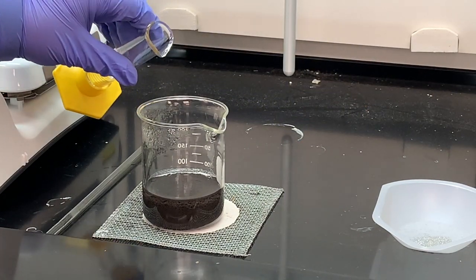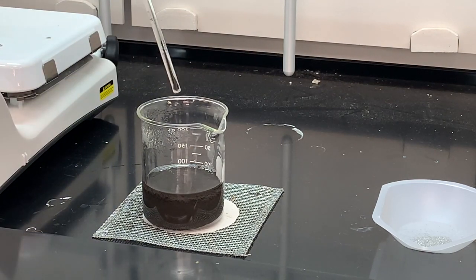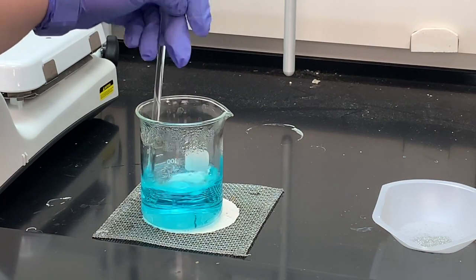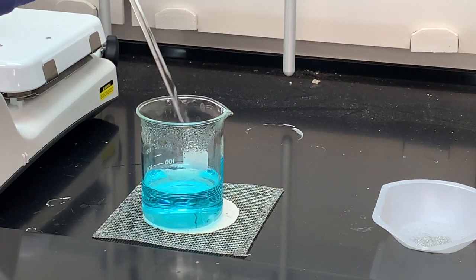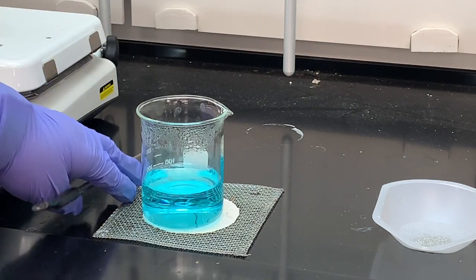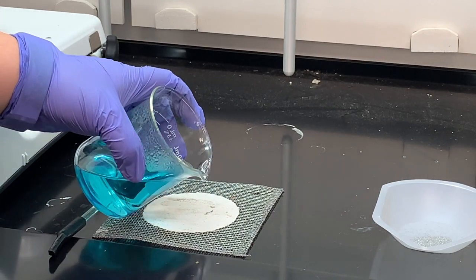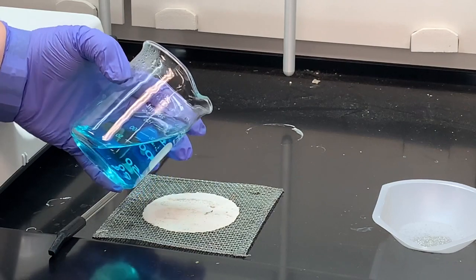I'm still doing all these reactions inside the hood. I'm just going to stir this up until I see a change. Here we have dissolved the copper oxide — that black solid — with the sulfuric acid, and now we have a blue solution. If I see any black particles around the sides of my beaker, I can tilt it and rinse those back in to make sure they also react with the sulfuric acid.